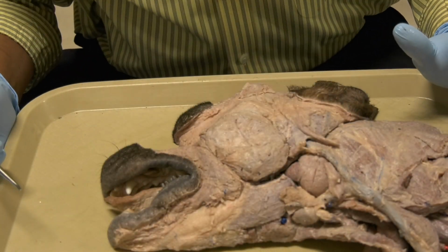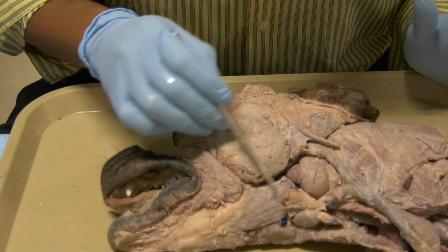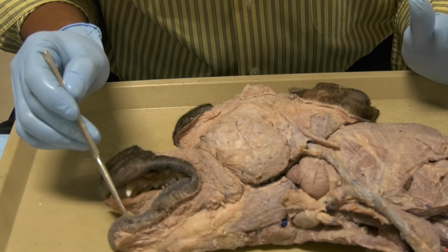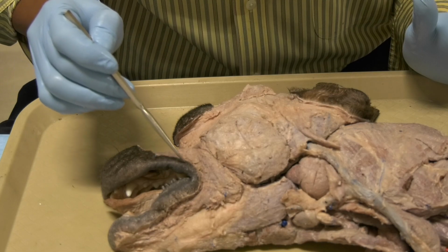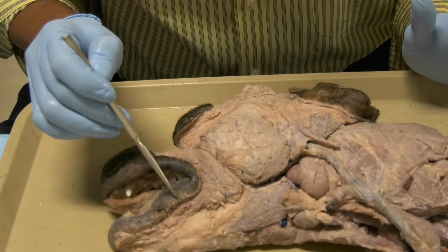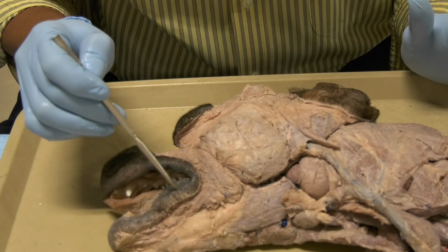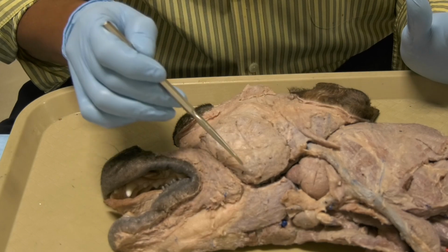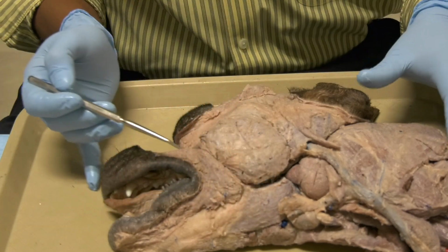Continue with the superficial structures besides the masseter muscle, besides the digastricus muscle, besides the buccinator muscle. There is the muscle of the lip, okay, that is sitting under the skin of the lips here, and that is the orbicularis oris. Then we have the buccinator, then we have the masseter, we have the digastricus over here.